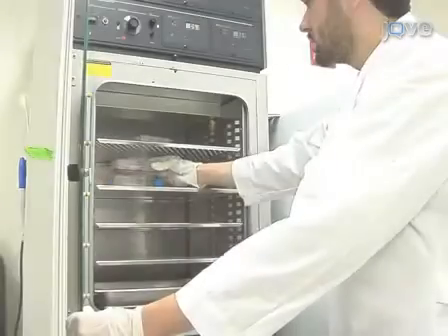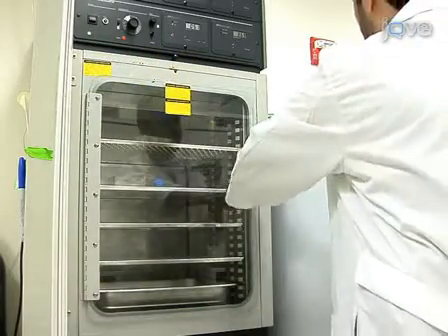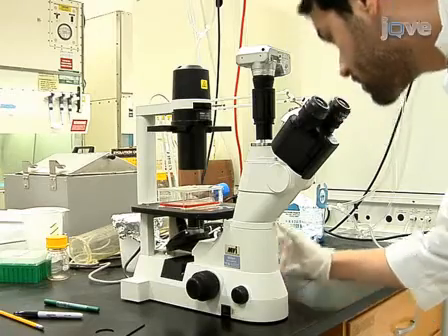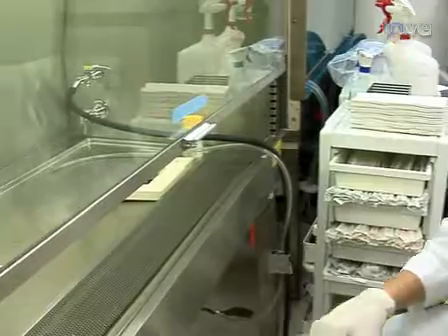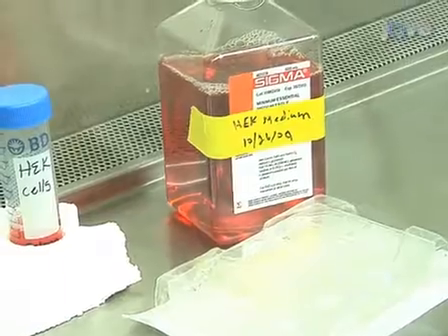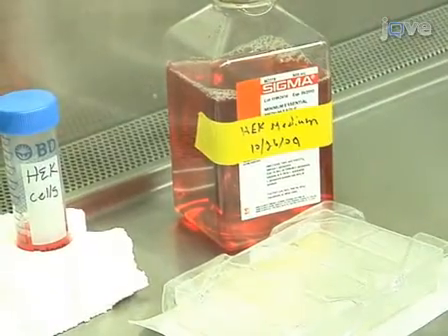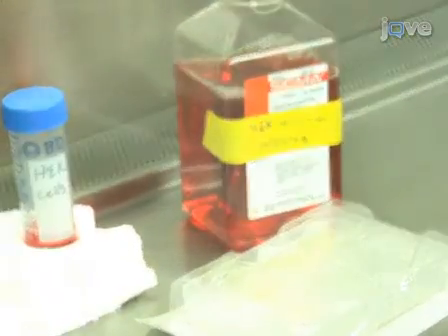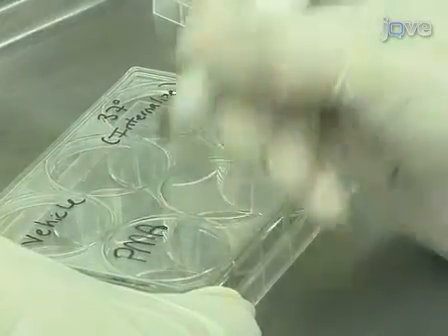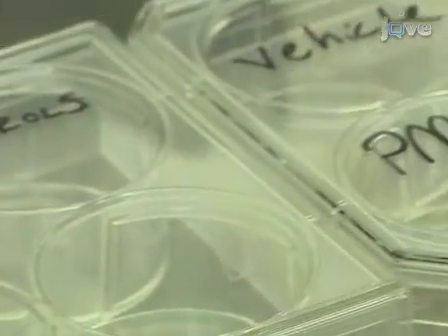One day in advance of the experiment, prepare cells and substrates for use on the following day. Cell types and media will vary, but if experimental cells are not strongly adherent, use an appropriate cell adhesion substrate such as poly-D-lysine-coated tissue culture plates. On each six-well plate, label four wells in total using two separate plates for each protein being tested.